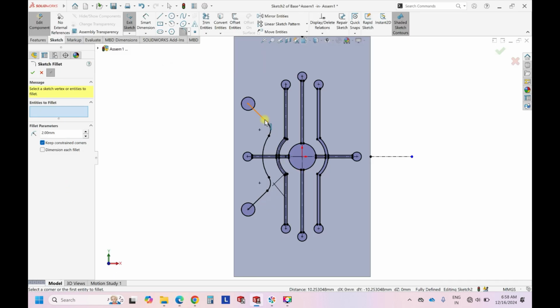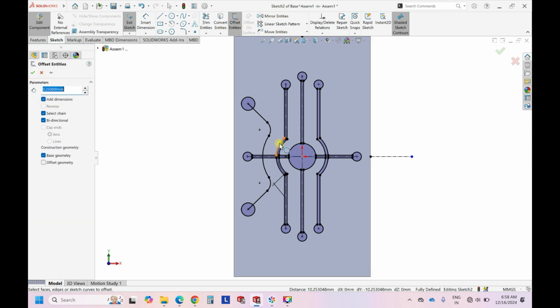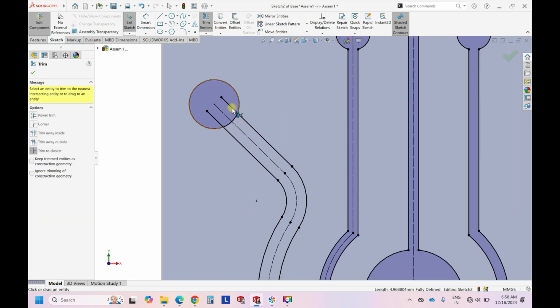So once it is done, you see, this is what the outer channels are looking like. But since they are bigger in dimensions, this is 0.5 or 500 micron that we have decided. So this we can give as 1. So to give 1, it should be 0.5, because it is 2-way. So once it is done, click OK, and then trim the unwanted portions.